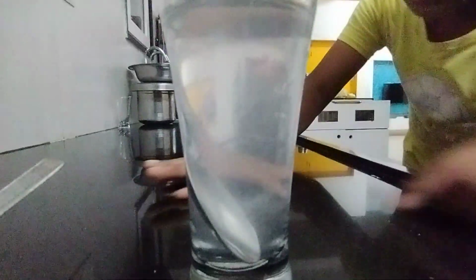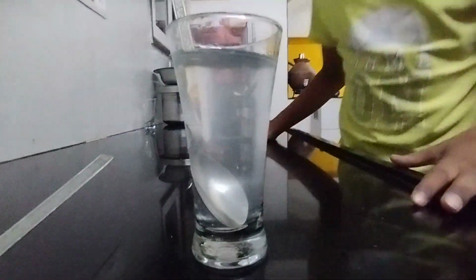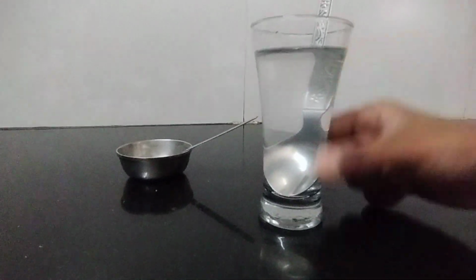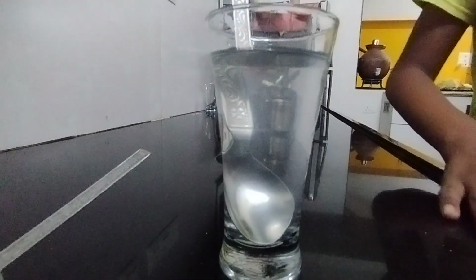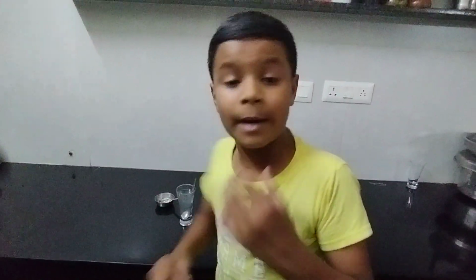Okay friends, now we can see it is completely dissolved. Some is there, but it has been dissolved. So here, now it is completely dissolved in water. Now we can see the color of the water has changed some. At that time it was fully white, but now it has changed some, because now it is completely dissolved. When it was adjusting, the color of the water became whitish because the particle color is white.